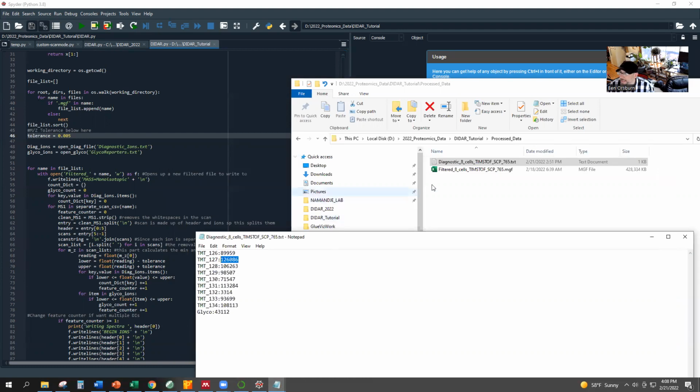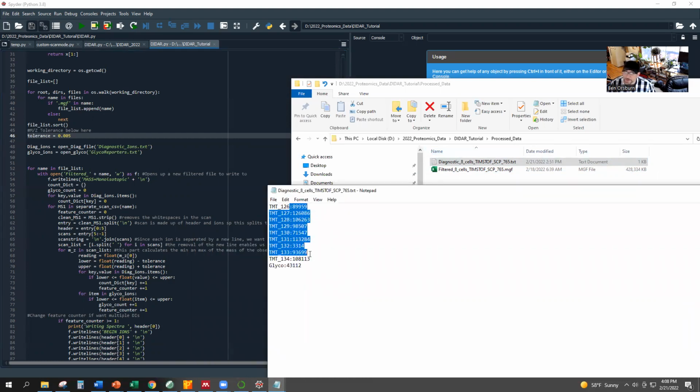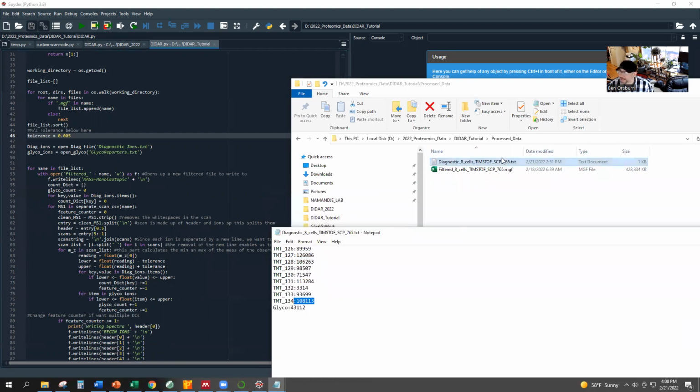And then if we look at the MGF, so for something like the timsTOF SCP, when you run through a reduction like this, you don't expect a great big drop in the data density, because you're really not throwing out that many spectra unless something went really wrong. These cells were prepped by a robot and were then analyzed at a really low flow rate. There are a few missing channels compared to some of the other data, the ones I showed in the PowerPoint. But really, that's it. This is the MGF.